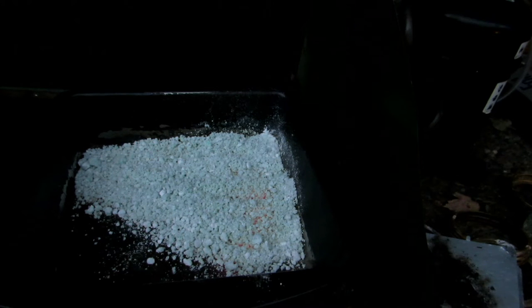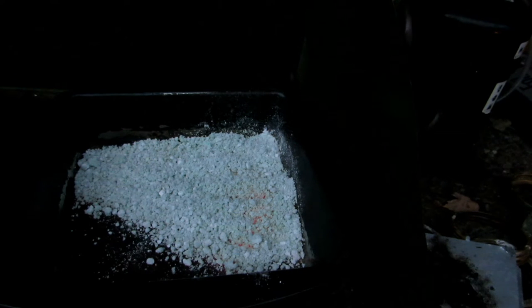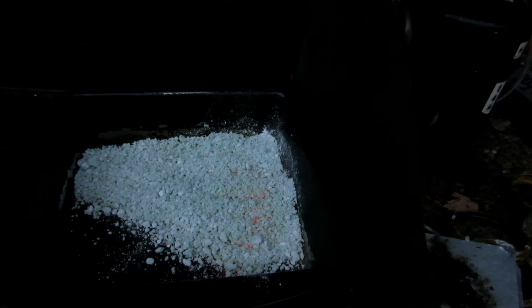This is probably because we're using an iron crucible type thing. Iron impurities are commonly present when producing sodium silicate. Even commercial grade samples can appear to be a bit green due to iron impurities. But this shouldn't matter for our application, because we're going to be using this sodium silicate to do a reaction known as a chemical garden, where you drop transition metal salts into a solution of sodium silicate and the insoluble metal silicates precipitate out. It's very cool.